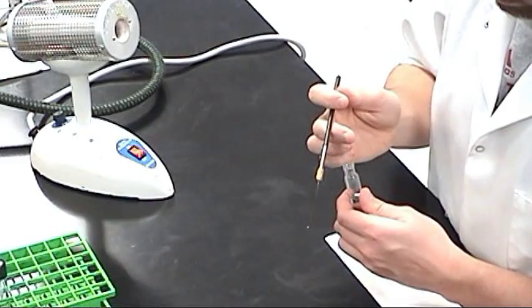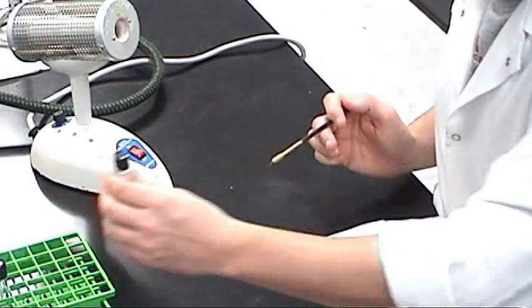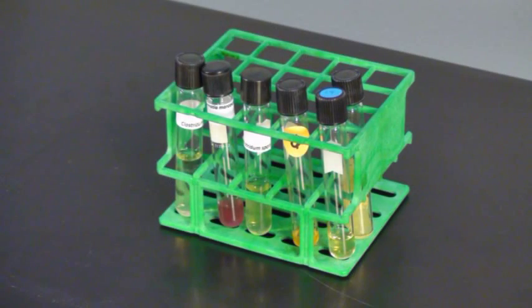This video demonstrates how to prepare a smear from a liquid medium and how to heat fix the smear. Many bacterial smears are prepared from a culture tube that contains liquid growth medium such as broth.